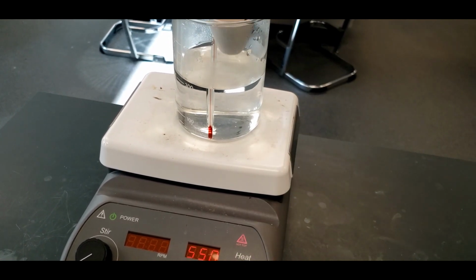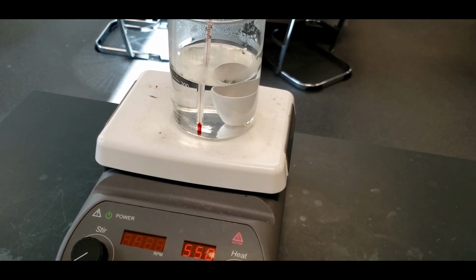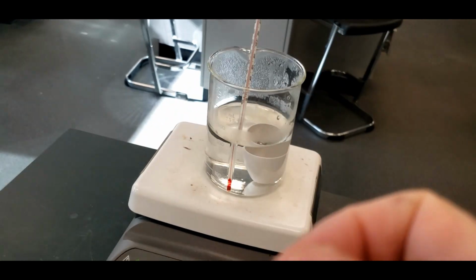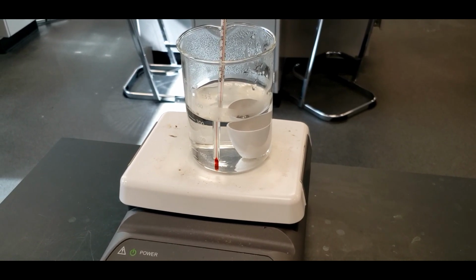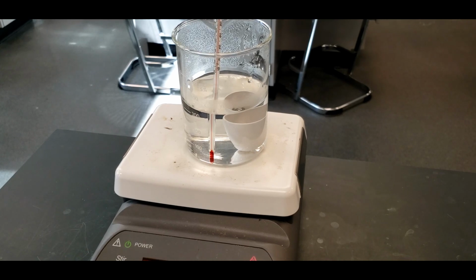So I'm going to put this in, and when we take it back out, there's going to be water in that crucible, and that's fine. But what we want is the ball bearing to sit in there for a few minutes and get up to 100 degrees Celsius, or whatever this has gotten to. I shut it off for a little bit, so it's at 90. I'm not going to have you watch it while it heats up, but once it gets to 100, we'll let it sit for about 3 minutes, and then we're going to take the ball bearing and put it into another test tube with water, and this will allow us to find the specific heat of the ball bearing.